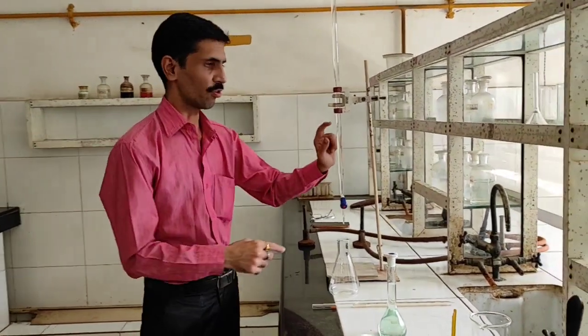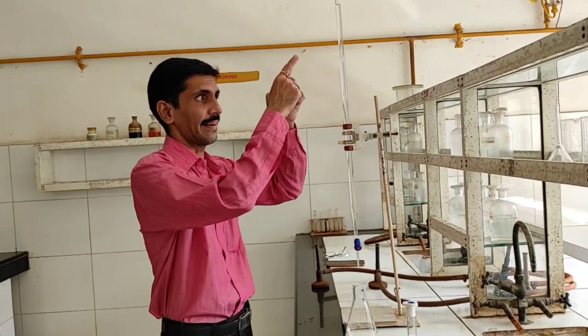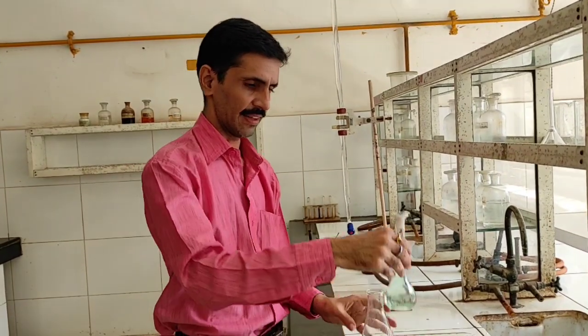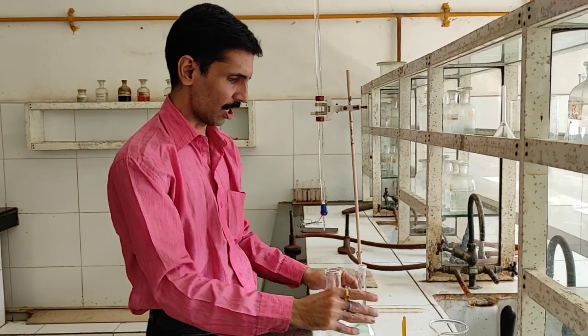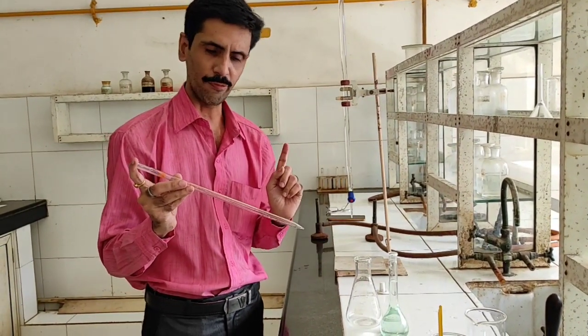Now, the next thing is the titration part. The titration has to be carried out with what? EDTA. EDTA is over here in the burette. If you remember, I told you in the theoretical part as well that this is a standardized EDTA, which we have already standardized against 0.01 molar zinc sulfate. So that standardized EDTA goes into the burette, already adjusted to the 0 level. Now what we need to do is very carefully open the cork of the solution and pipette out 10 ml. This is a 10 ml pipette. You are going to pipette out 10 ml of this solution into this conical flask.